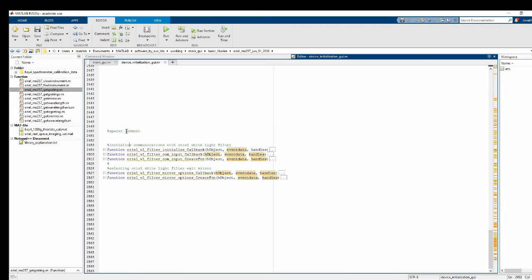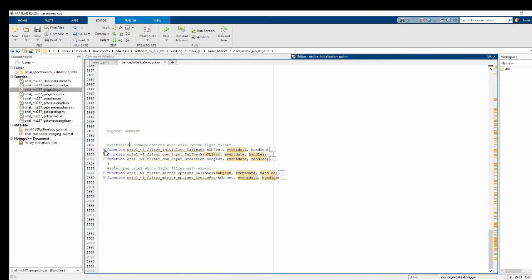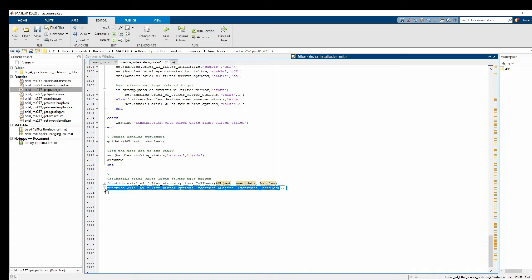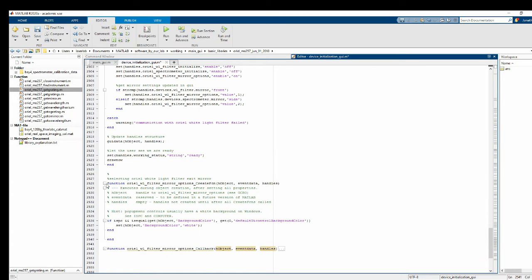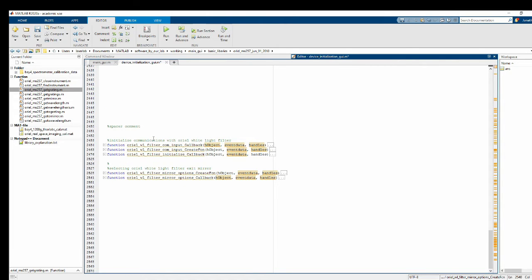Okay, so next, all right, let's program in the mirror selection button. Let me pull up my notes for this. All right, the callback function for the mirror. And you know what? I kind of always prefer for my callback function to be the lowest one, because it's sort of like easier to read it to me. So I'm just going to move my callback buttons to be on the bottom. Doesn't really matter. I guess there is something to say about the order in which the code would execute. Callback would always be last compared to an input or a creation function.